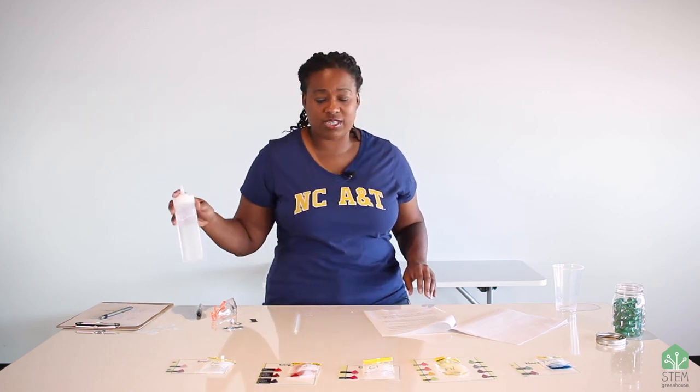That was part one of today's activity and experiment. Now you have enough indicators to test one more sample. This time we're going to test not the water that comes from your sink or tap water, but something different — bottled water. You might be wondering: is the bottled water we drink safer or healthier than the water that comes from your tap? Repeat these steps using the bottled water instead of your tap water, write down the observations, and compare the samples. You might find that your tap water is just as safe or safer than the bottled water, or you might find that your tap water has a lot of one of these minerals and you will need to make some changes to your water quality at home.